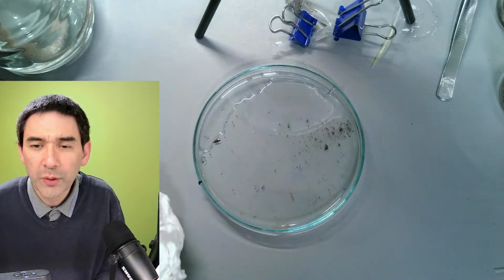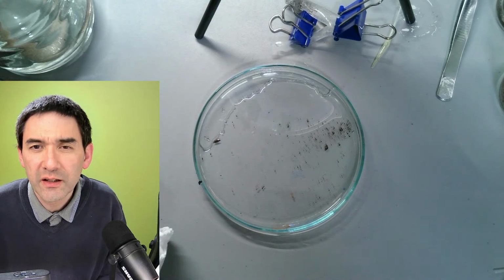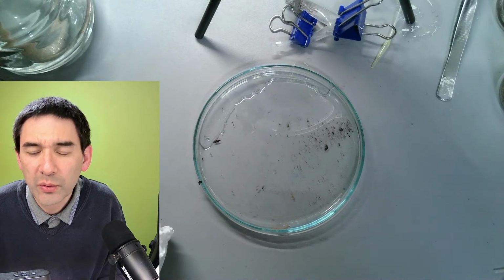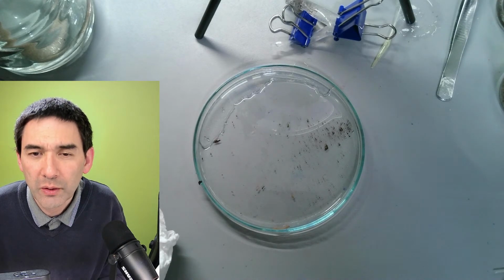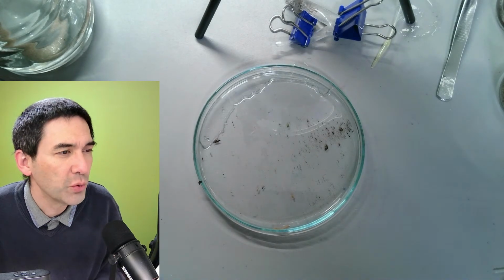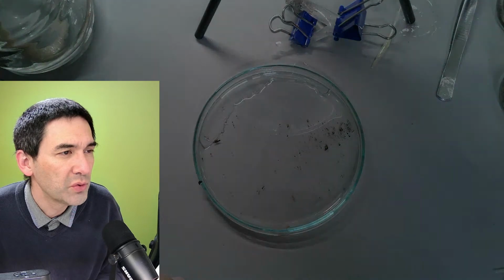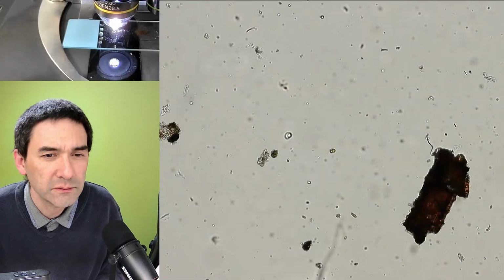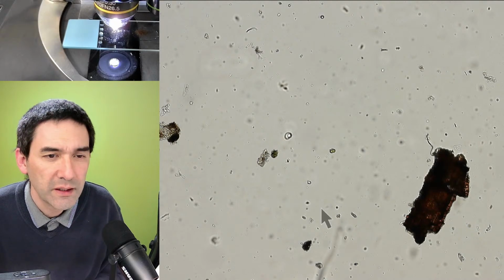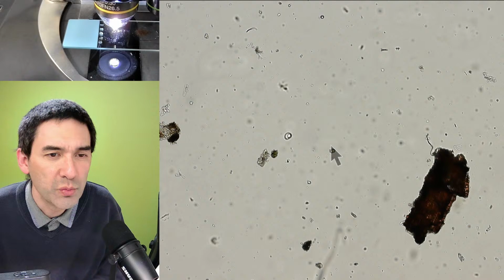There were a couple of questions. One of the questions that I just read is: where do I get the arrows from? Mike was asking this. Where do you get the arrows? So I'll show you. I have to go to the scope view again here. I've got some arrows over here that I can move around. And the question is where I made them.